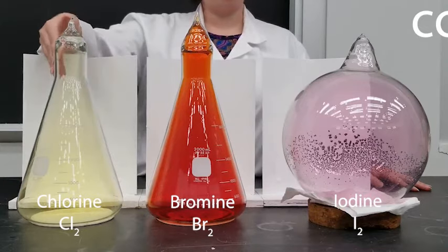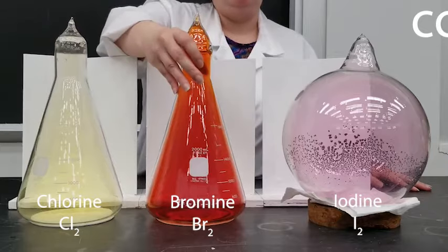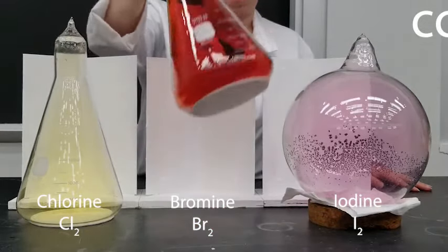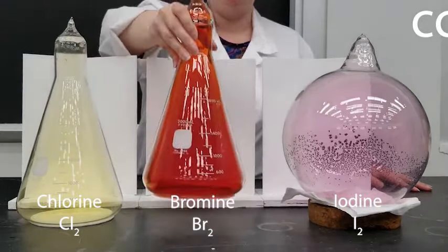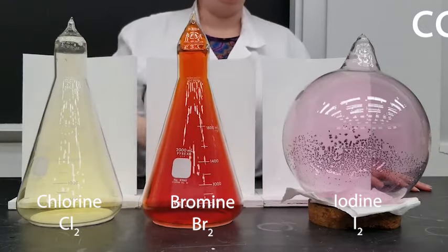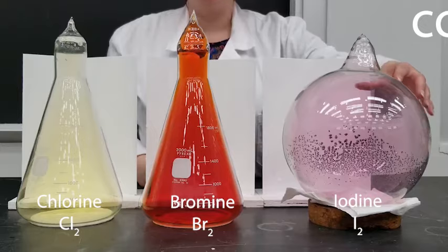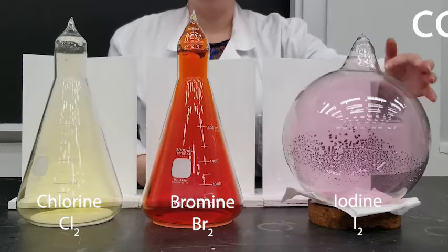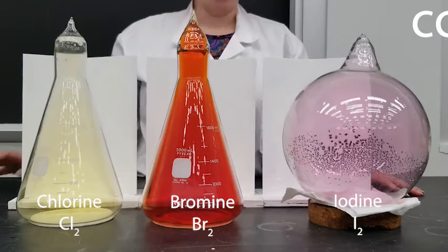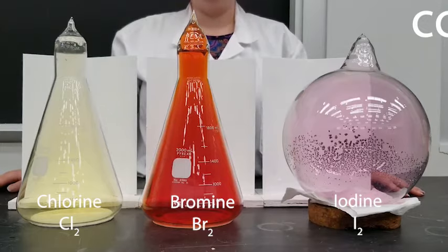Chlorine, as you can see, is a yellowish gas. Bromine is a liquid at room temperature, but you can see from the brownish gas that it has a very high vapor pressure. Iodine is a solid at room temperature, but you can see from the purple vapor that it also has a high vapor pressure. Iodine also sublimes — it goes straight from solid to gas.